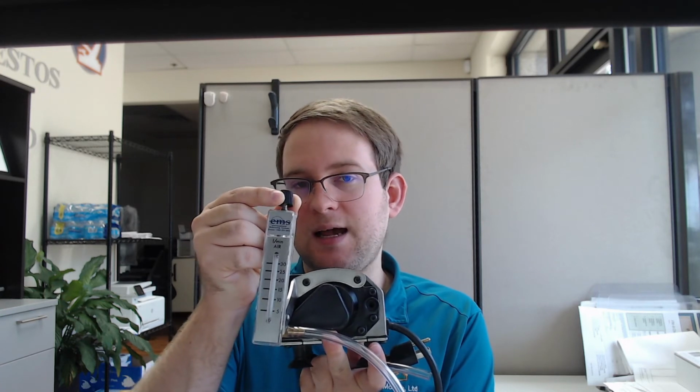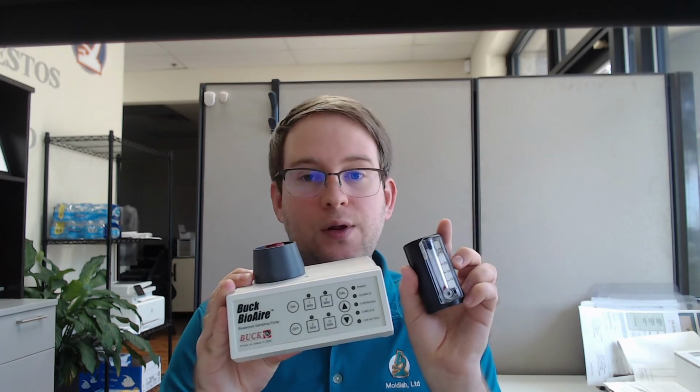Next, you'll need to get your air pump ready. There are a wide variety of air pumps on the market, but most of them are similar to one of the two pumps I have to show you today. Pumps like this Thomas Mega-Lite must be plugged into the wall and use 1/4 inch inner diameter plastic tubing to connect to your cassette. This pump has a manual flow rate control using this black dial and has an attached rotometer. Other pumps, such as the Bioaire, allow you to attach your sample directly to the pump and are battery operated. This pump has a digital flow rate control and comes with a separate rotometer to measure the flow rate.